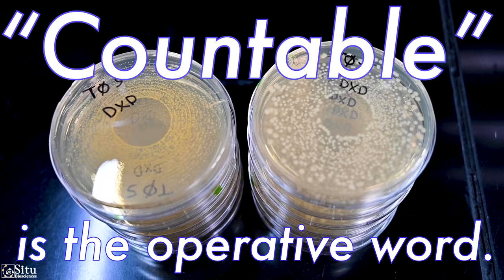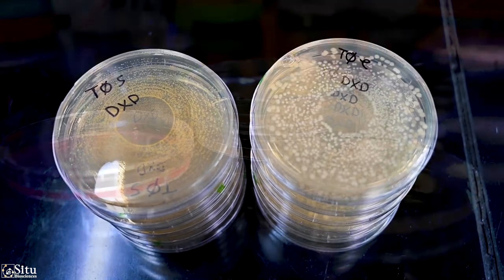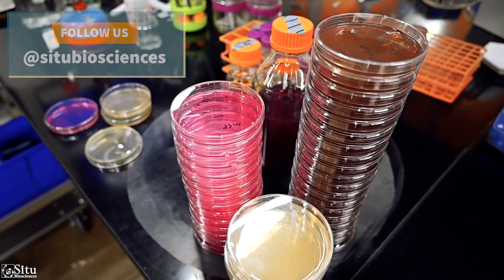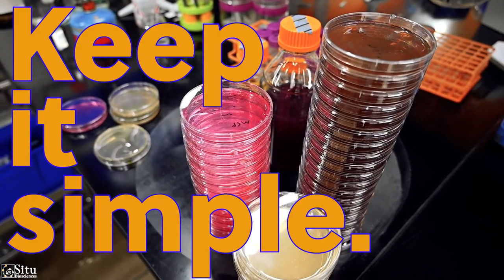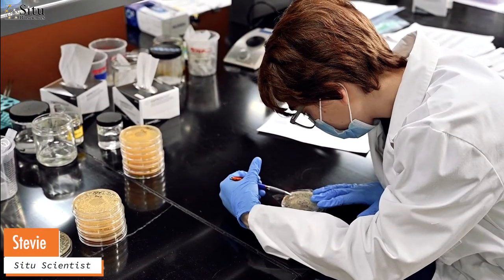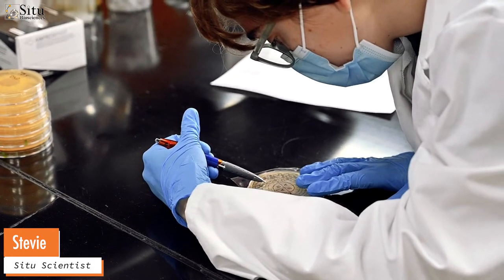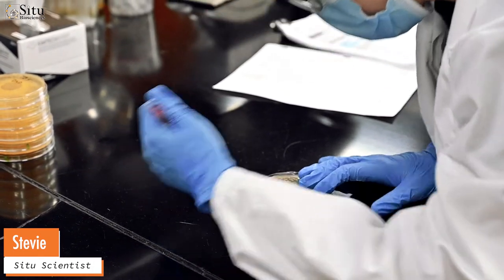Countable is the operative word here. Though much of the world of microbiological testing can be infinitely technical and variable, it's also keenly practical. We need to get to a place where we can count a reasonable amount of something. Bacterial counts into the hundreds is more reasonable than attempting to count into the thousands or let alone millions.